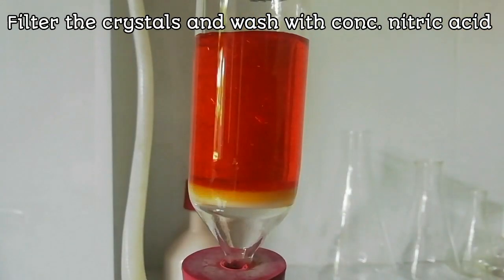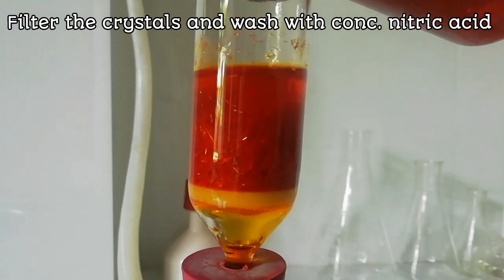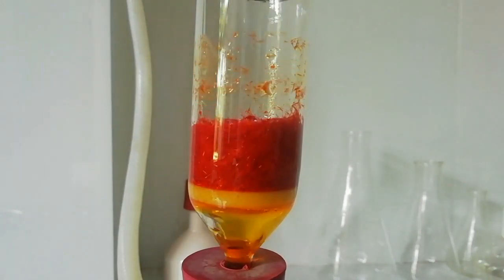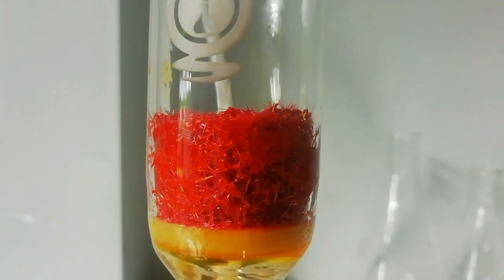Then crystals were carefully filtered and washed with a little amount of concentrated nitric acid. After that, crystals were dried using a steam bath.